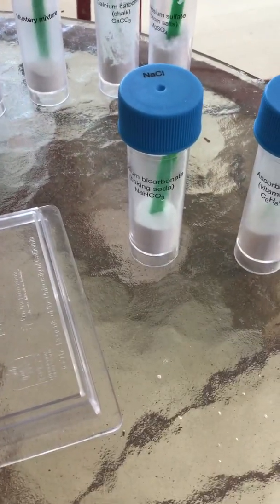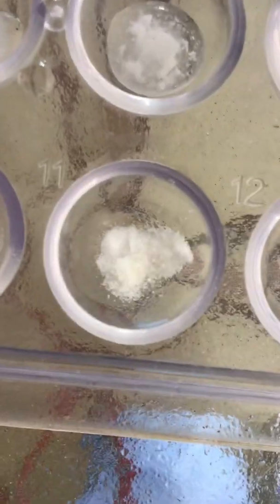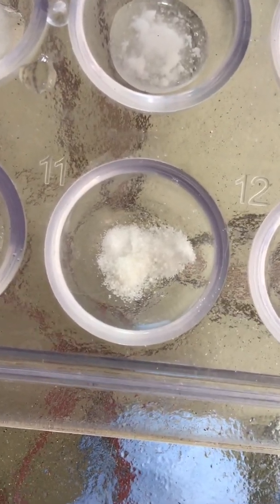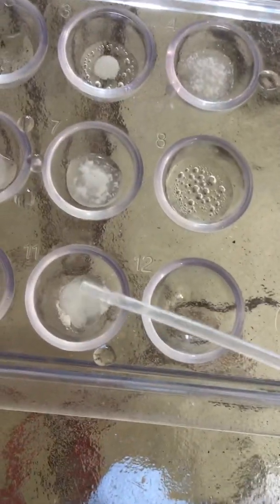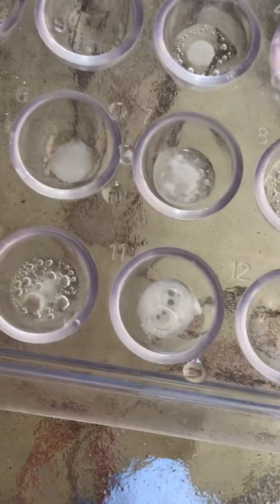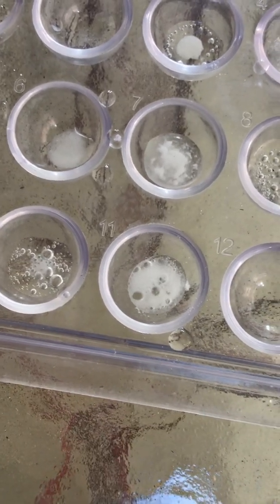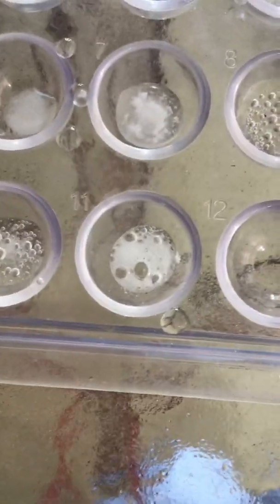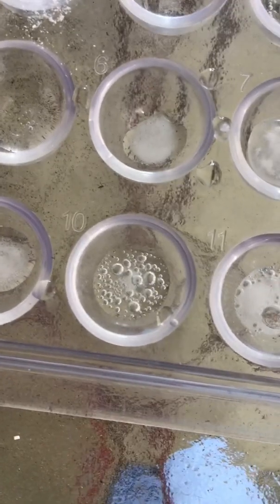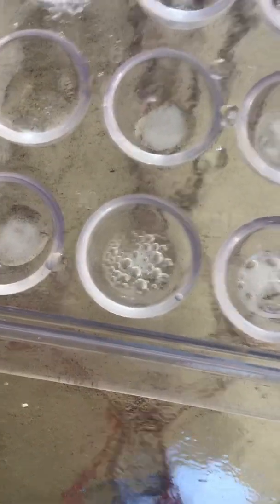I will try sodium bicarbonate—the baking soda—with ascorbic acid. This is what it looks like. Now I'm going to add some water. Hmm. This might be what's in the mystery mixture. I'm not sure. This one has a residue still, so it definitely cannot be citric acid and sodium bicarbonate. Let's see if this one leaves a residue.